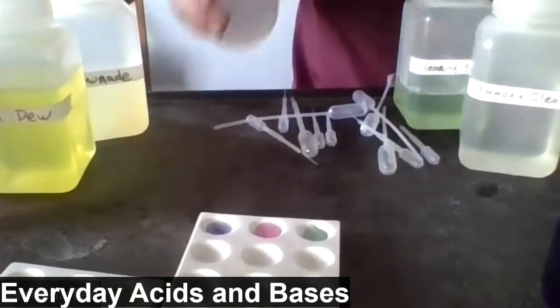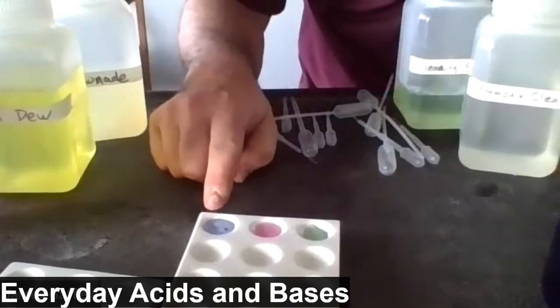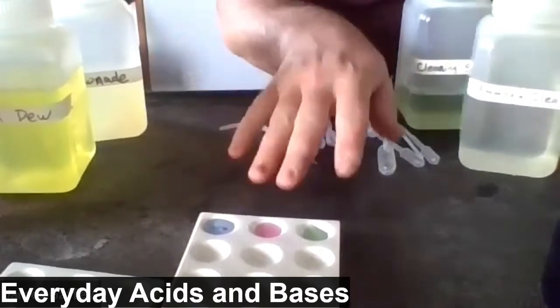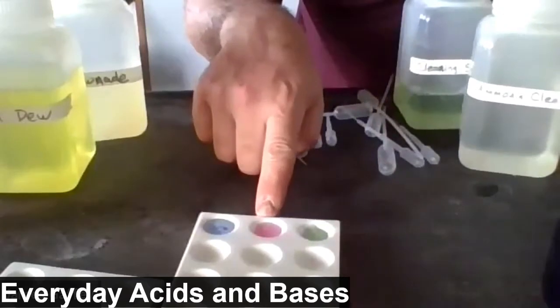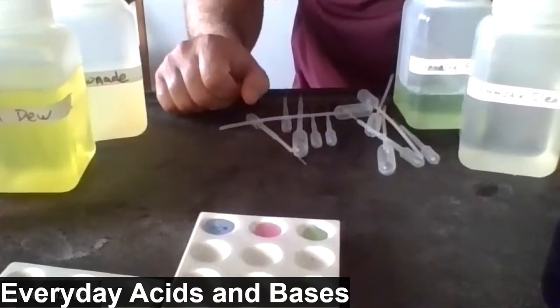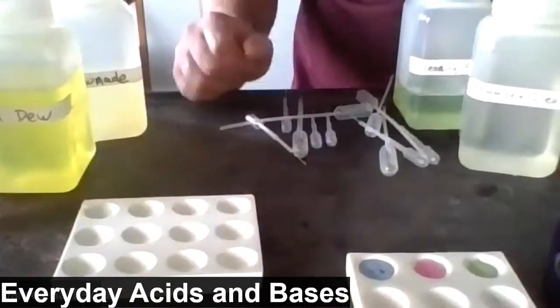And to the well on the right, I'm going to add a little bit of water. No noticeable color change, but it may have gotten a little bit lighter, become a slightly lighter purple color. Okay, so these are our standards. The base became bluish greenish. The acid became reddish. The water stayed purple, although it may have been slightly less intense coloring. Those are our standards.